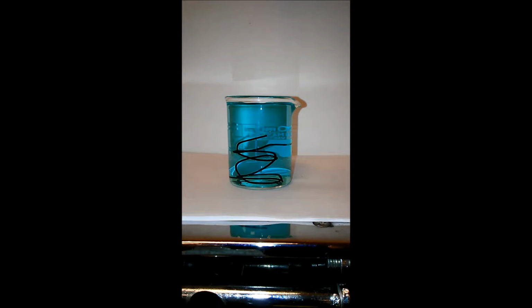These two, which have been going since first period and last period, this one here, this was silver nitrate solution with copper metal in it. And so if you look at its reaction equation, when those two replace one another, silver comes out and we end up forming a copper nitrate solution. This solution was clear to start with, but notice now it's turning the blue color. We're making this stuff with this reaction. And the shiny stuff that you see on the surface there, that's silver.